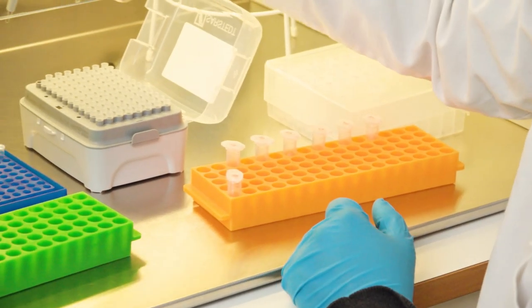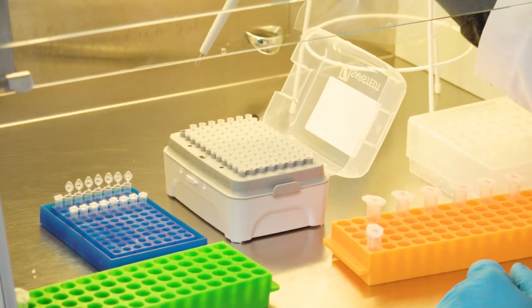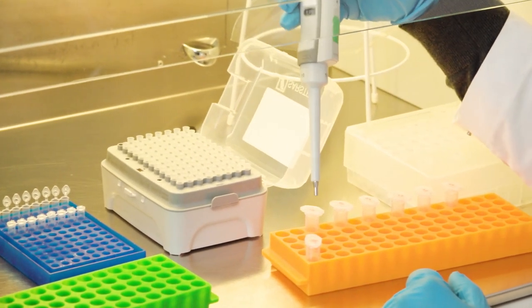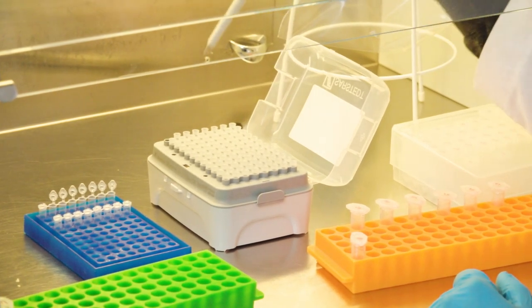Because now I have many ways of seeing where I am, both with the lids that are open or not, where the sample is on the rack, but also on the map I make with the pipet tips.